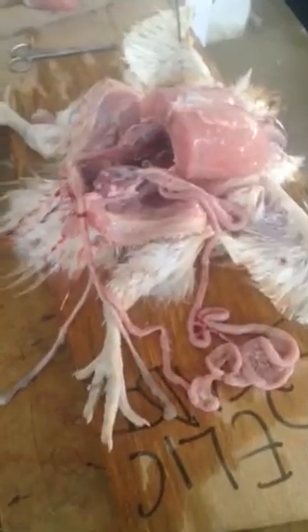So please, that is that for the digestive system. You already know what is entailed.